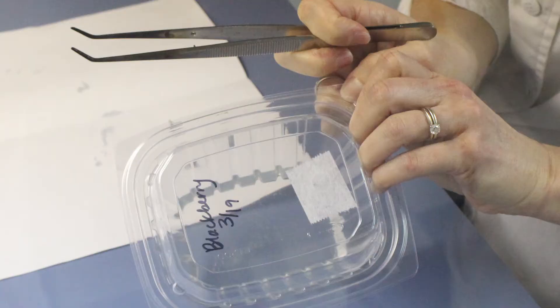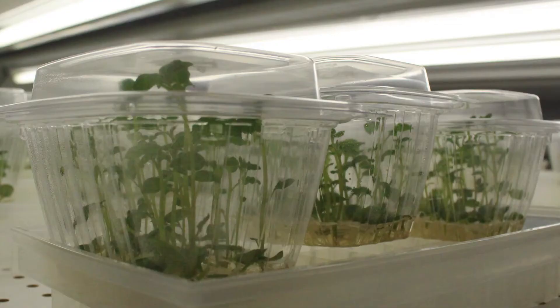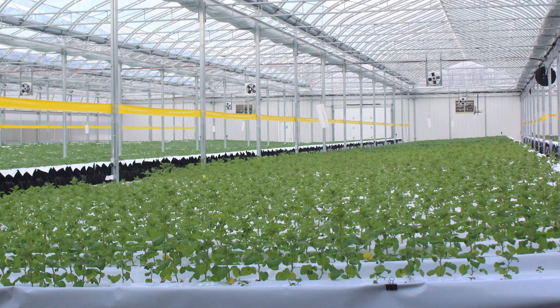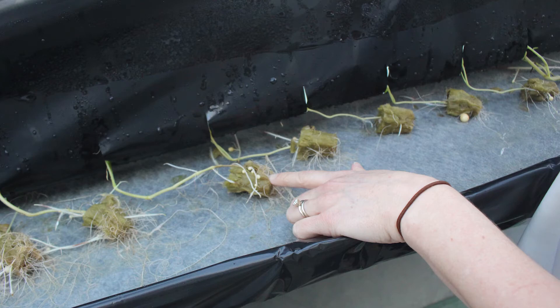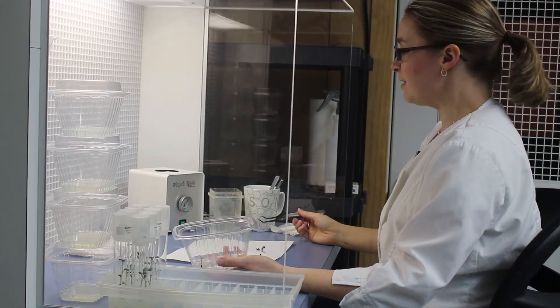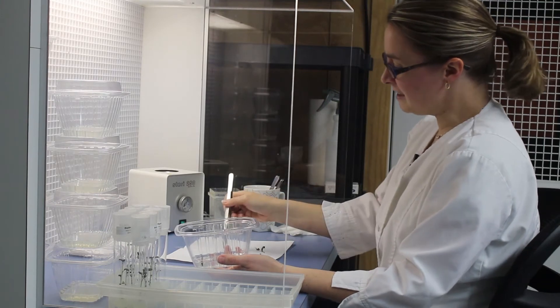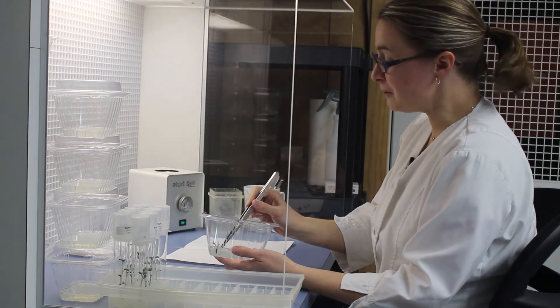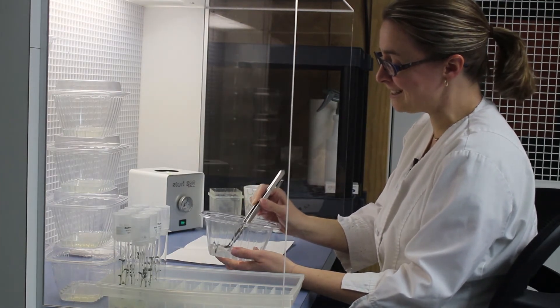And I'll sterilize my tweezers. We usually count to about seven to ten seconds. We like it when it sizzles when it comes out and we know it's nice and hot.